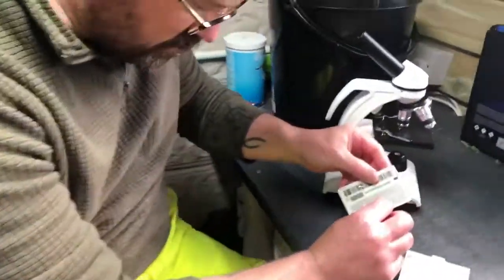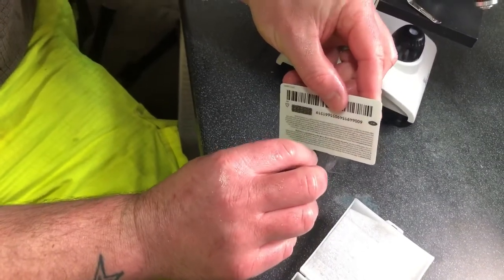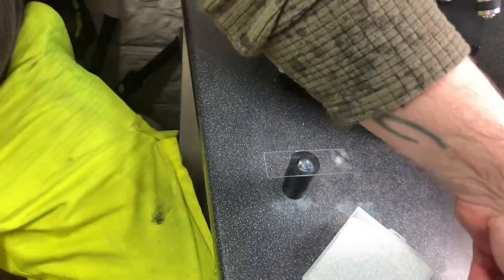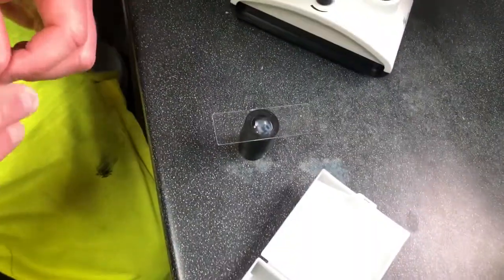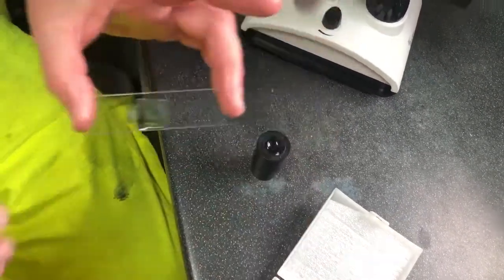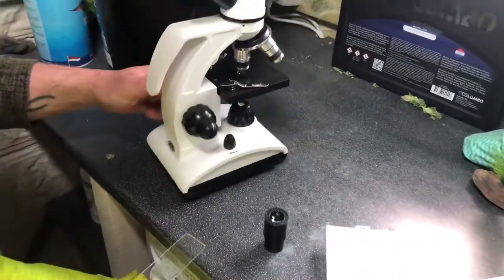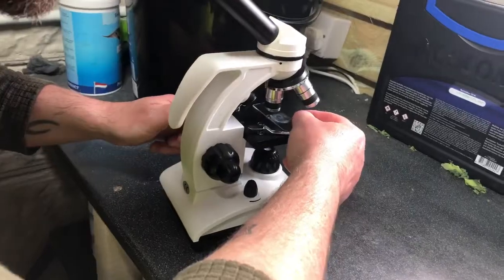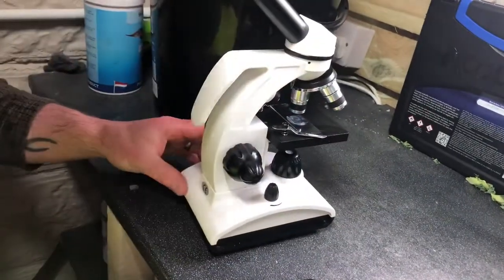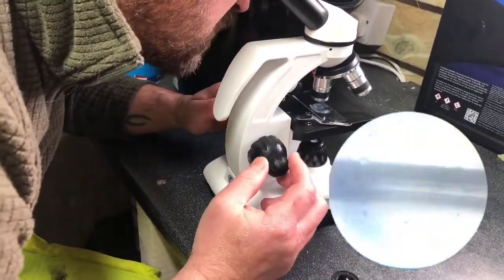This is the other sample — we've just come indoors now. I've got a much better sample for this one, so we're just going to take some of that slime coat and drop that onto the slide. I haven't got any pond water up here but there was water on the sample anyway, so I'm just going to press that down. Under the microscope, objective lens-wise we've got 25 times magnification, so I'm just going to do that on 10 for now so I can have a look.